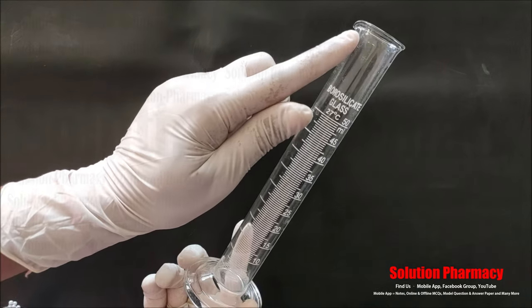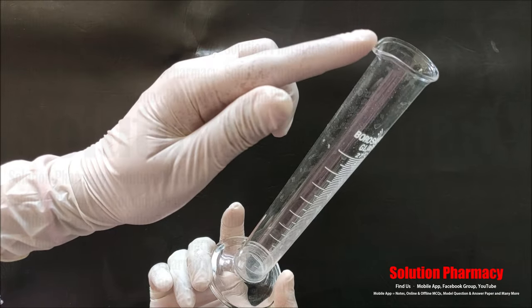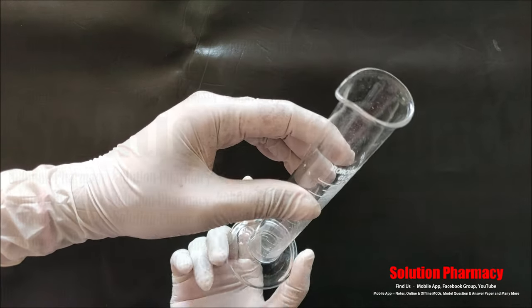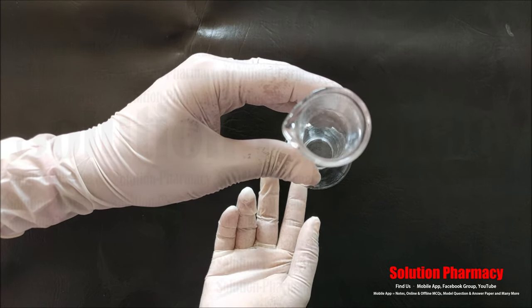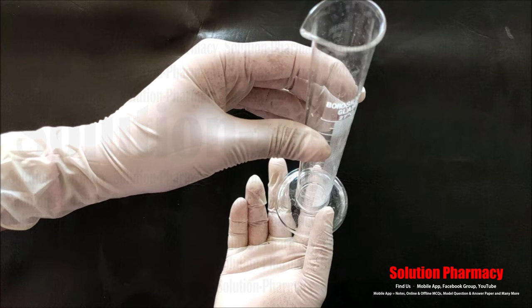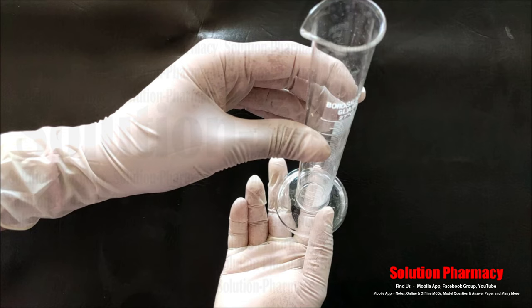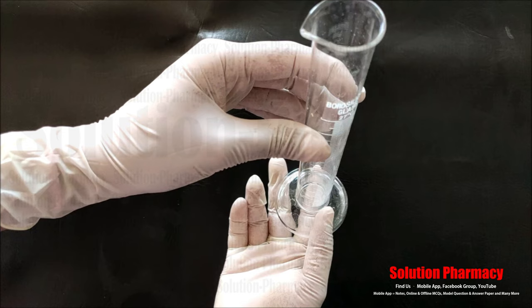You can also see that this measuring cylinder has a spout, which means we can transfer liquid through it. Compared to a beaker or conical flask, the volume measurement with a measuring cylinder is more accurate. So if we have to measure the volume of a liquid, we prefer the measuring cylinder. Different volumes are available: 10 ml, 25 ml, 50 ml, 100 ml, 500 ml, and 1000 ml.